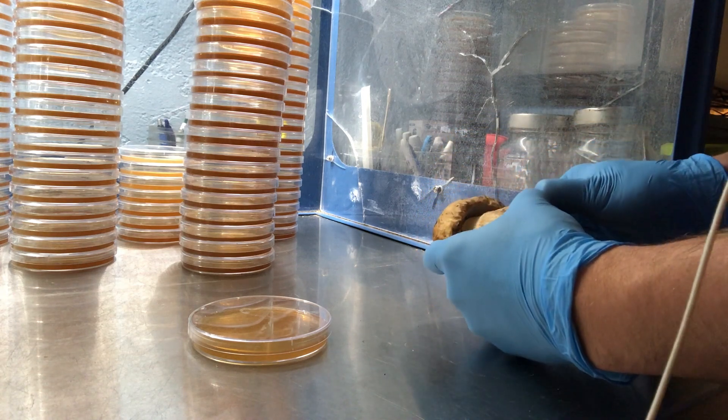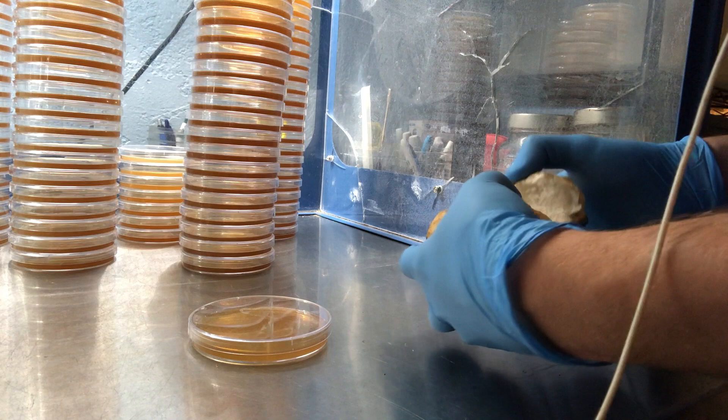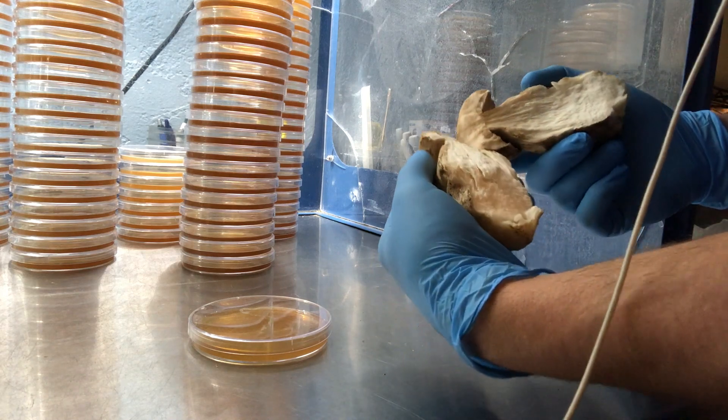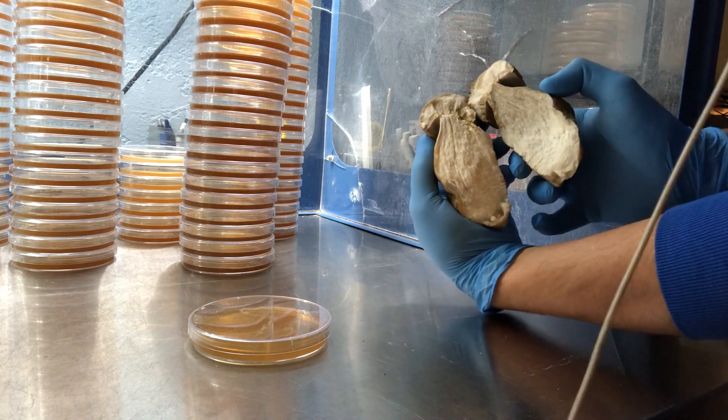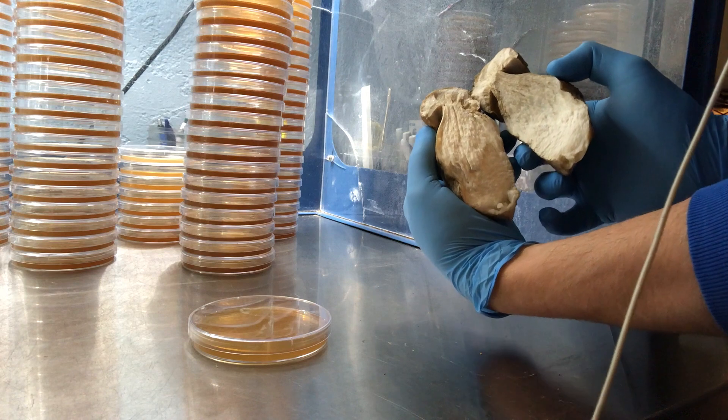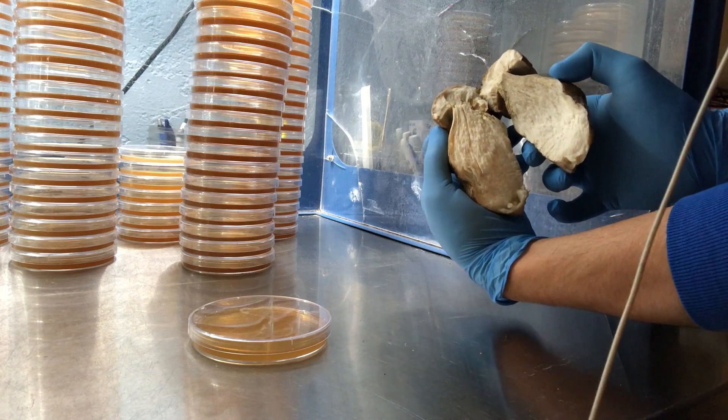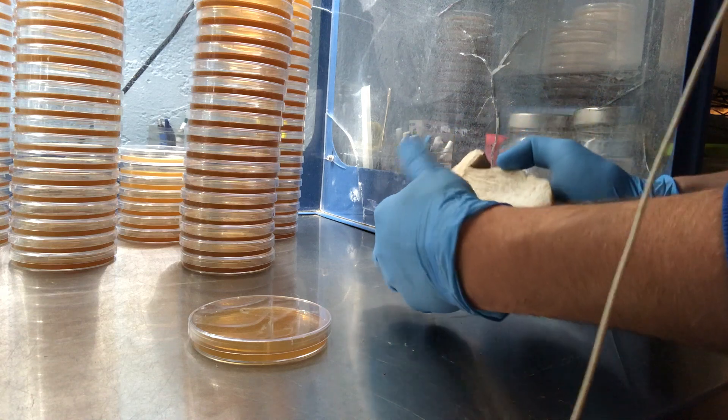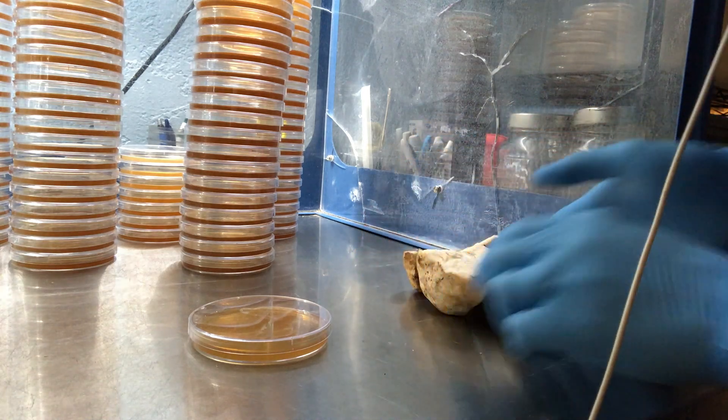Look at that beautiful interior. We've got some really nice fresh tissue there, and I'm gonna be trying to take my clone probably from the middle of that stem where there's gonna be the least amount of contaminants.